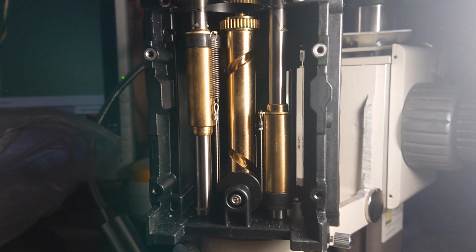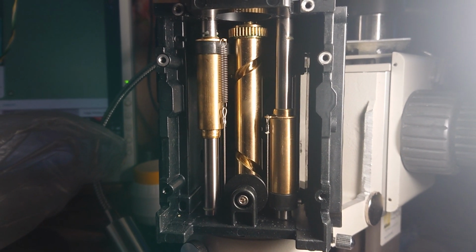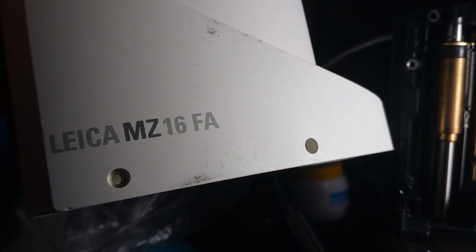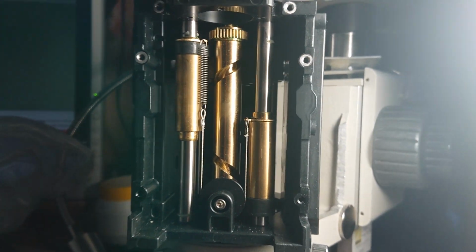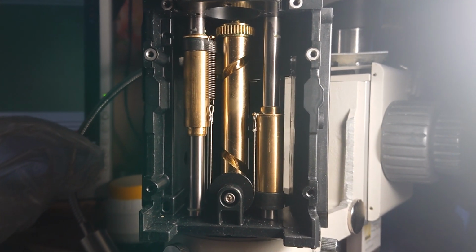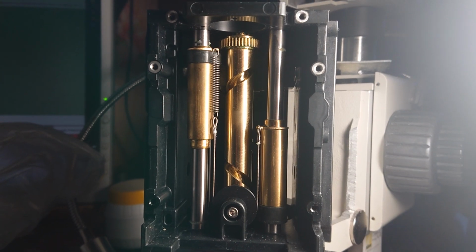Hello everybody. Here I've got a very strangely designed, three separate channeled Leica MZ16 FA microscope. It has a bit unusual design with two separate stereo channels and one with a little less resolution.